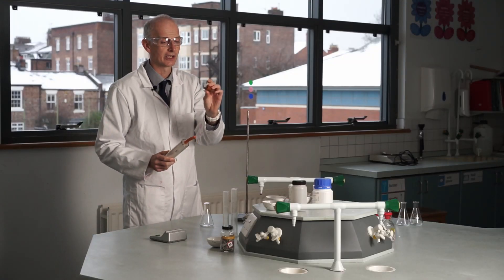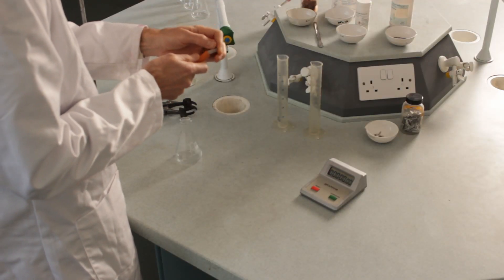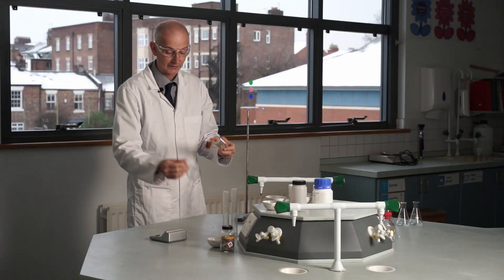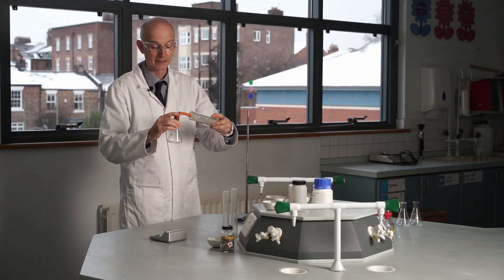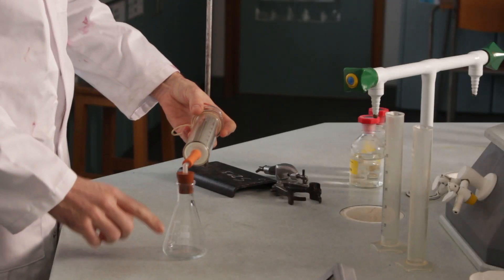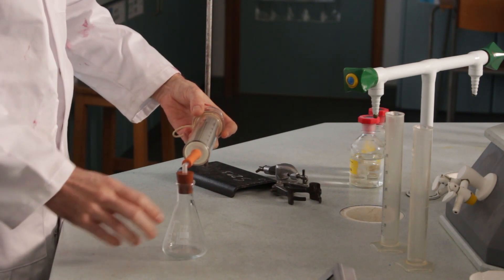And this is a little adapter which goes on to it, which pops in to make it fit into a conical flask. So standard conical flask, pop that in there, and we've got a sealed system. So any gas which is produced in here will end up pushing the plunger back here and we can measure how much of it there is.